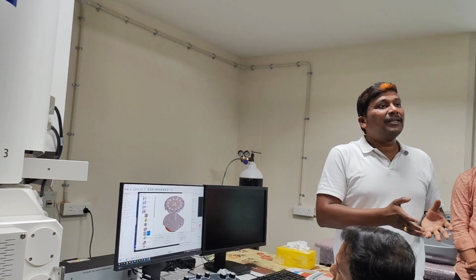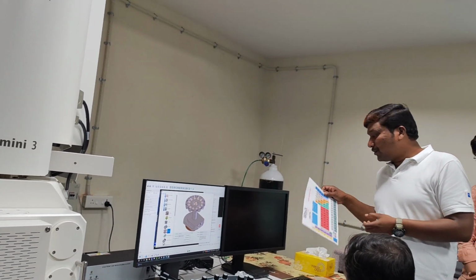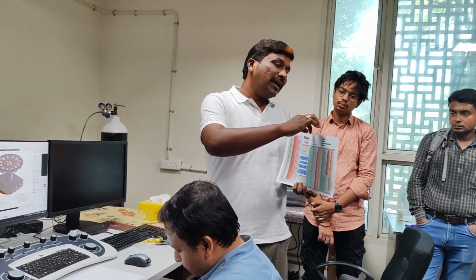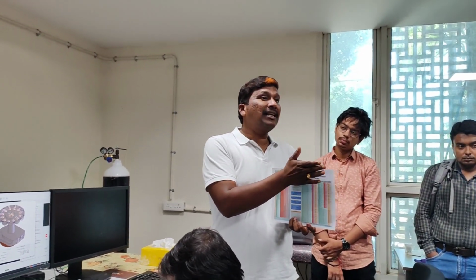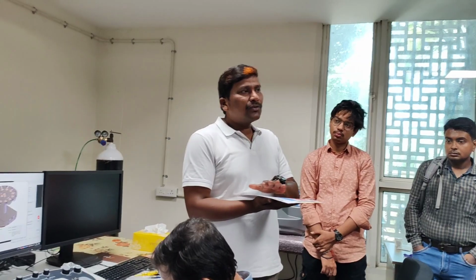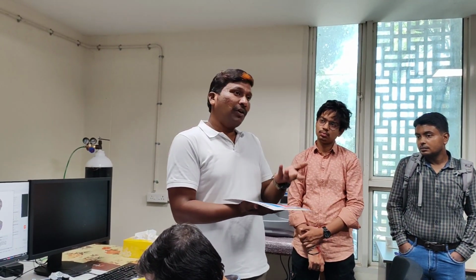But when you have too much interaction volume, again, the cross section, how will you do the cross section? For example, this is your sample, and if you coat the sample like this, you have to prepare a cross section like this and image the multiple layers here, right? But one part of that sample, the base, is glass. Glass is completely non-conductive. If you have a silicon wafer, it is also very flat with nano roughness, right? So even your thin film surface properties depend on how adhesive it is and what you are looking for.